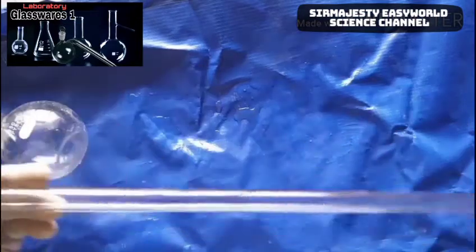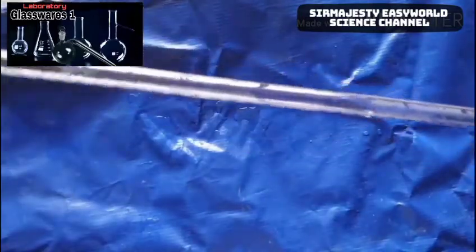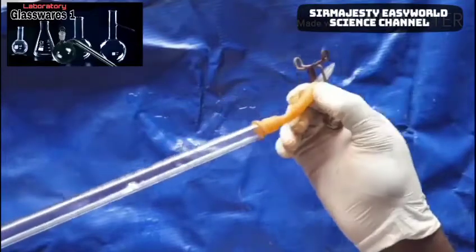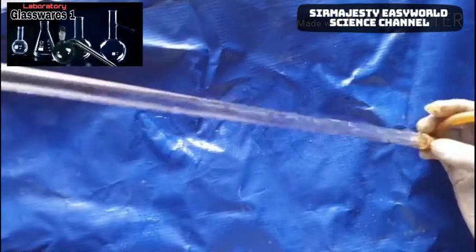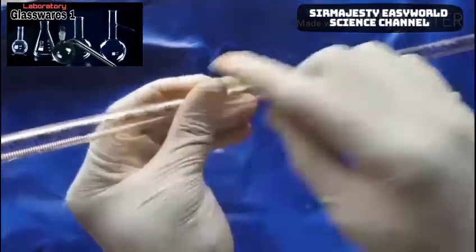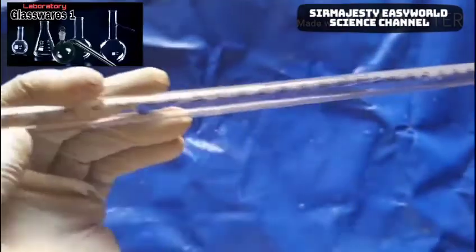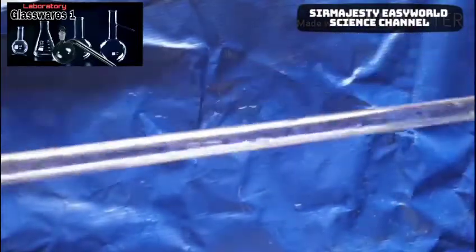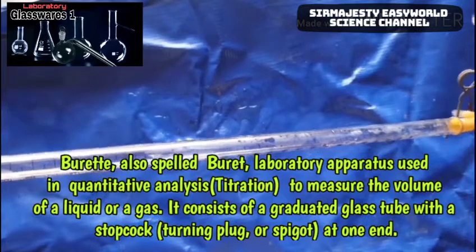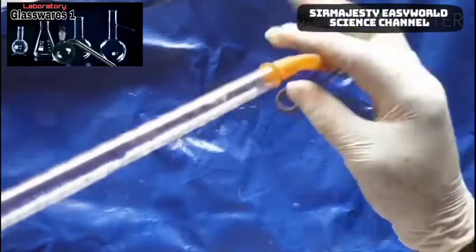Next we have the burette. The burette is a glass tube with a tap at one end and it is graduated. Commonly we have 50 ml, 100 ml, and 150 ml depending on usage. The graduation starts from the top going down, marking zero at the top. The zero mark is at the beginning and when you go down you reach the 50 ml mark. It is used for titration — to add a known volume to another measured volume during titration.